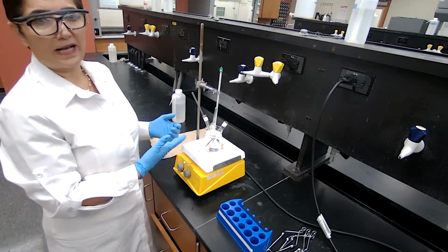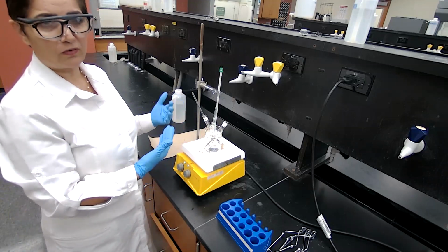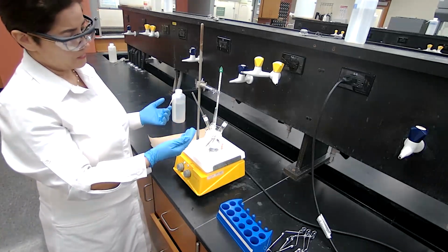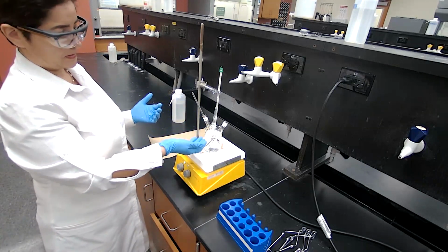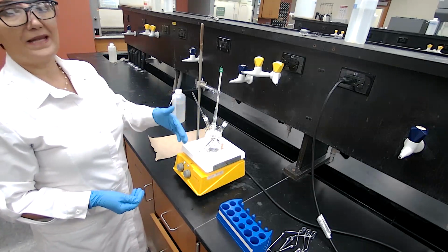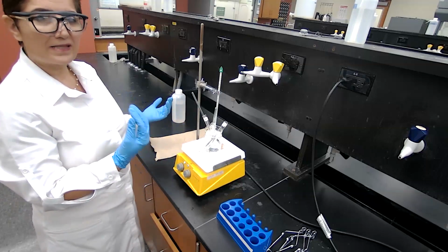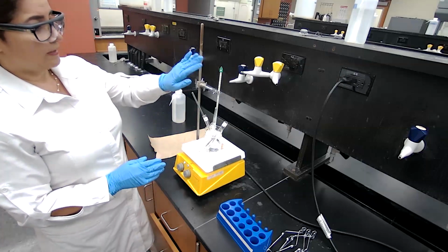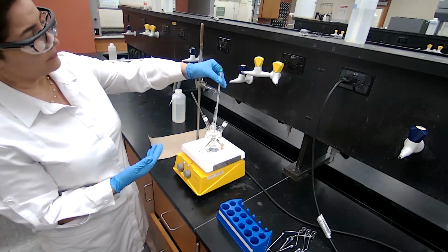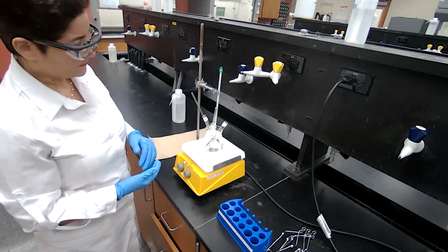So if the boiling point of the alcohol and the acid is high enough, it's okay for this water to start boiling, or the water bath temperature can go higher. But especially with test tube A, when we have methanol, if the temperature of the hot water goes too high, it can evaporate the methanol before the reaction takes place, and then you'll be wondering why you can't smell the ester. So keeping the temperature at the suggested temperature has its own reasoning. It's not just a random number.